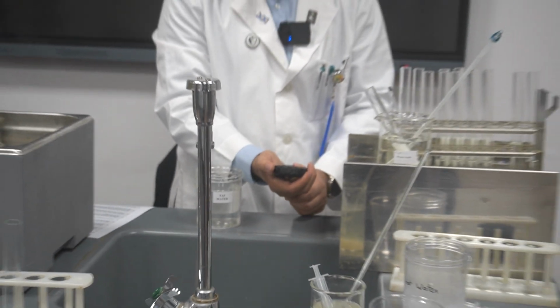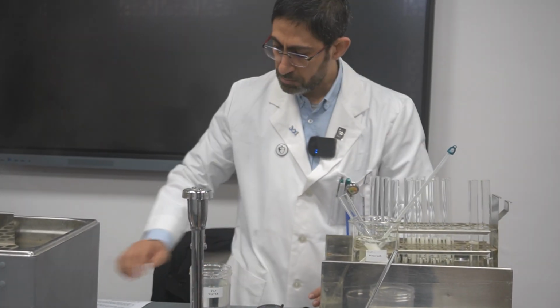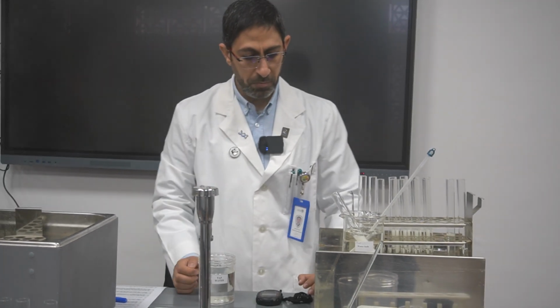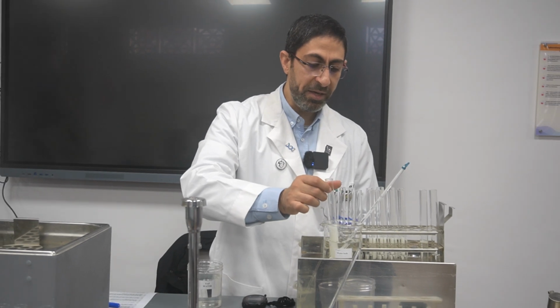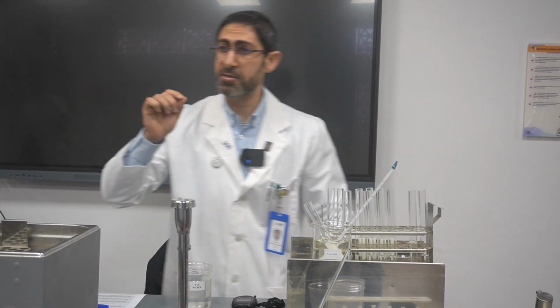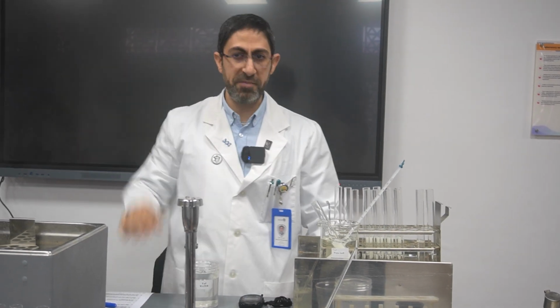I'll use a stopwatch. Our end point is when you can see the X. The faster you see the X, the faster the enzyme activity.